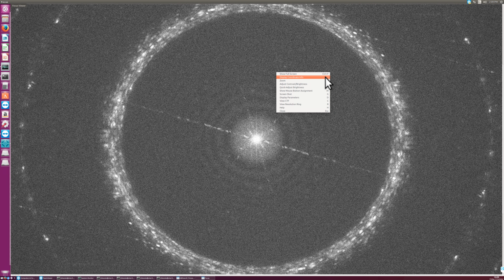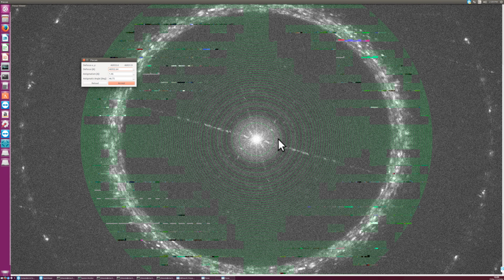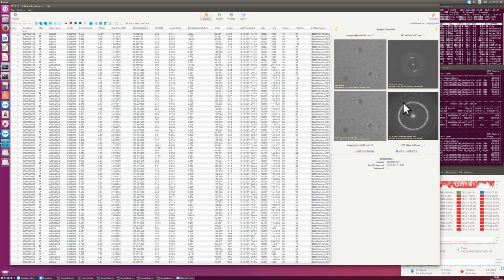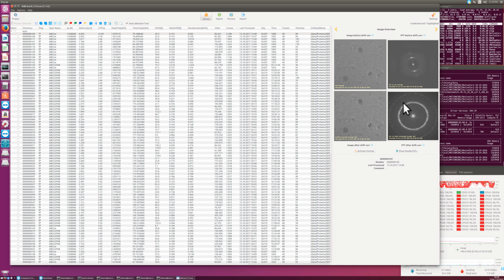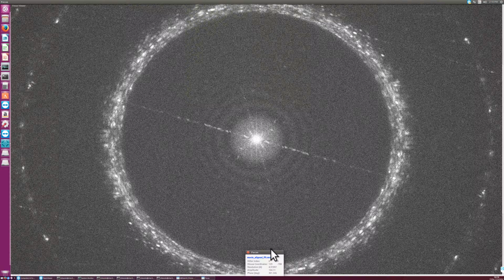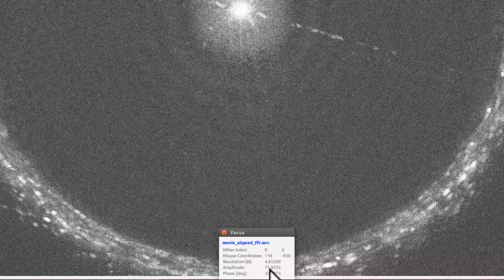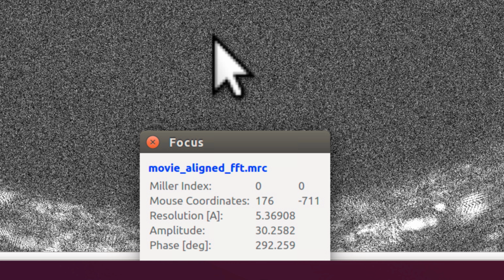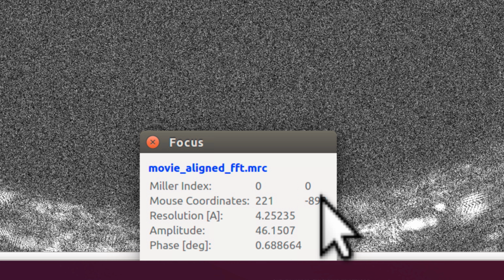And with the letter I can display the coordinate info. I can show you this. So if I press C, we have the Thon rings, and these do not fit, so these Thon rings are wrong. Well, I leave this out. This defocus determination completely failed on this image. And then we have the letter I, that is the resolution in angstroms down here. So this always shows the resolution of the pixel where the mouse is, the mouse coordinates and the resolution in Fourier space, and then the amplitude and phase values at that pixel position.